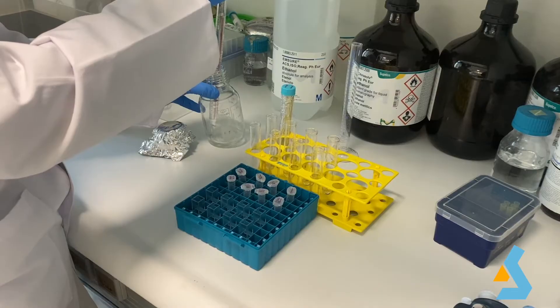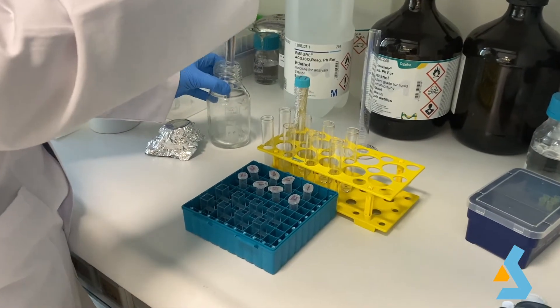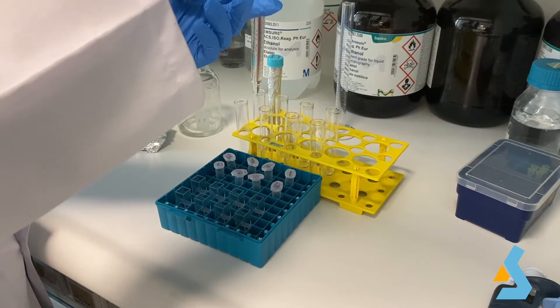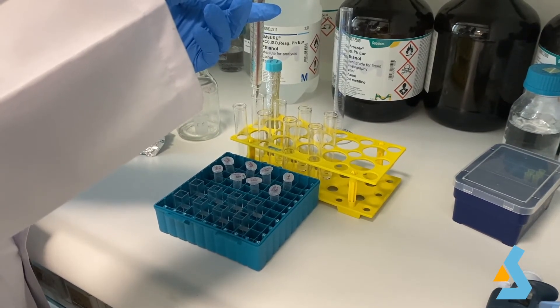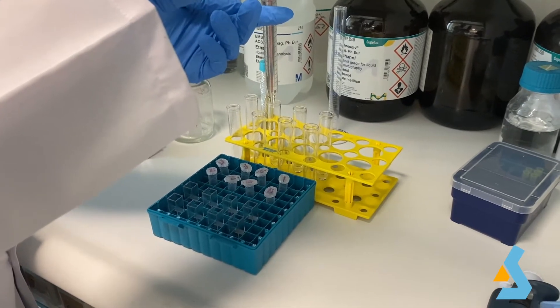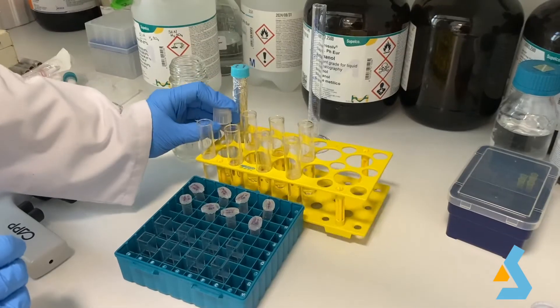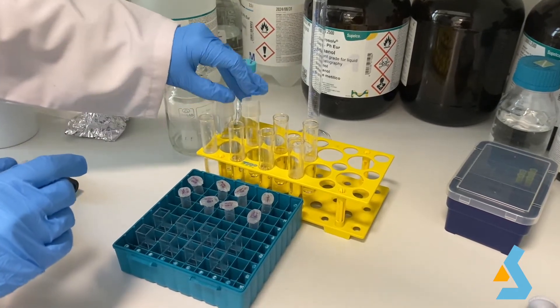In the last step of the reaction, we add 96% sulfuric acid to obtain colored compounds. After that, we close the lids of the tubes and let the reaction be completed at room temperature for 10 minutes.